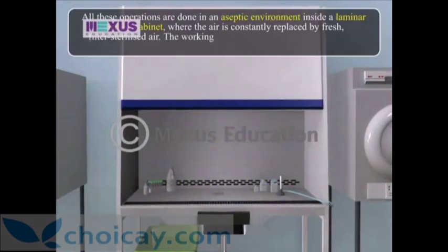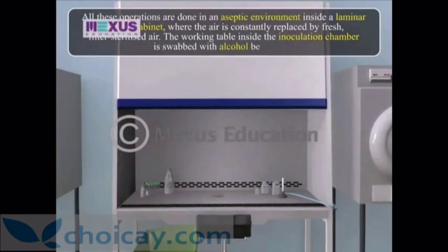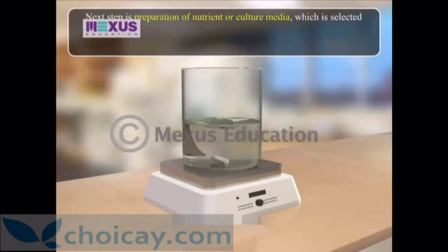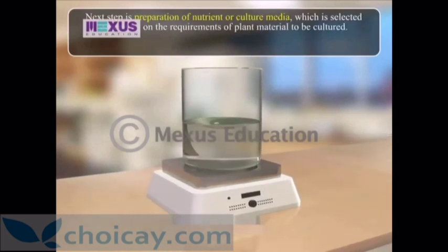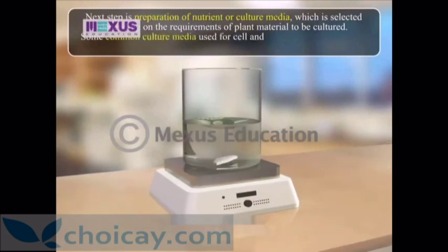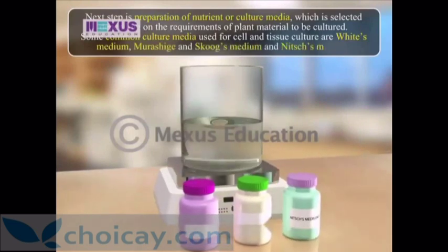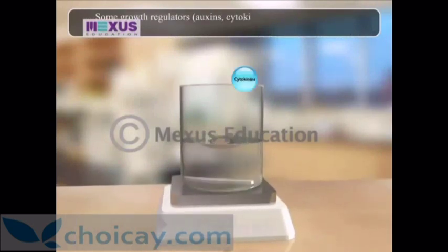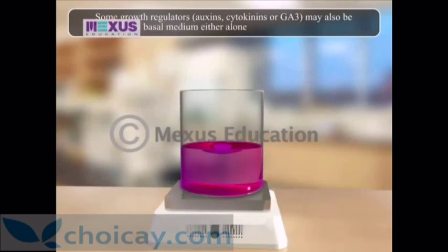The working table inside the inoculation chamber is swabbed with alcohol before use. The next step is the preparation of nutrient or culture medium, which is selected depending on the requirements of the plant material to be cultured. Some common culture media used are White's medium, Murashige and Skoog's medium, and Nitsch's medium. Some growth regulators like auxins, cytokinins or GA3 may also be added to the basal medium, either alone or in various combinations.